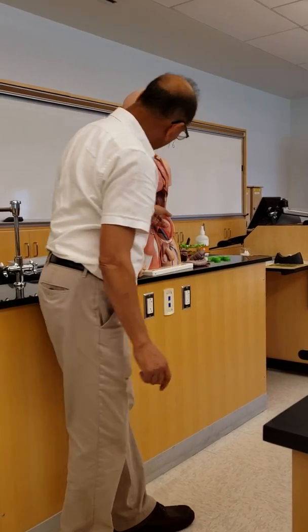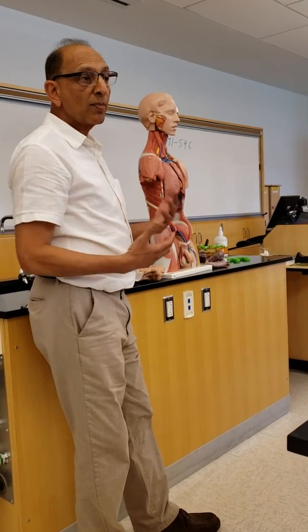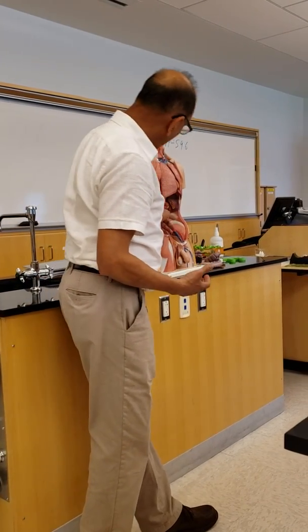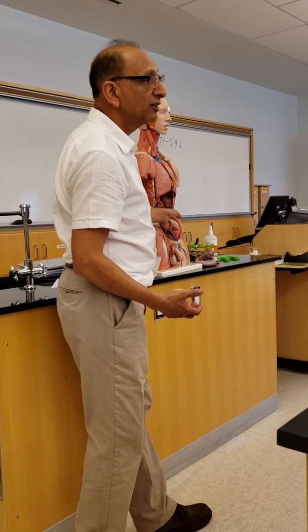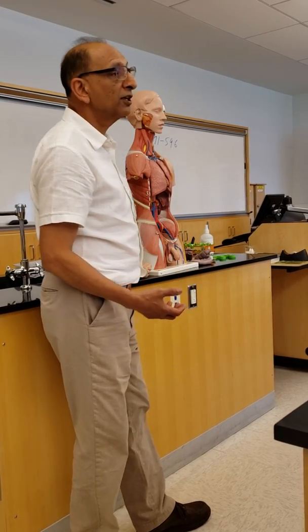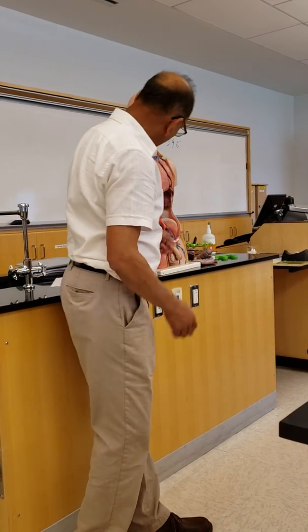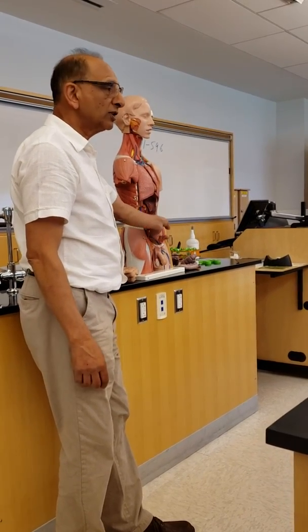And there you go. You see these kidneys here? They're way back, right? Way back. And you can see the aorta, inferior vena cava. So from the aorta goes red color renal artery, and blue color is renal vein. And you see the ureter, the tube going down, ureter.